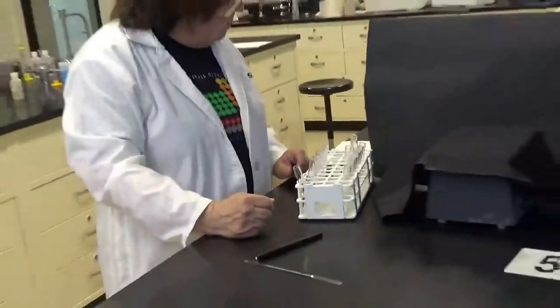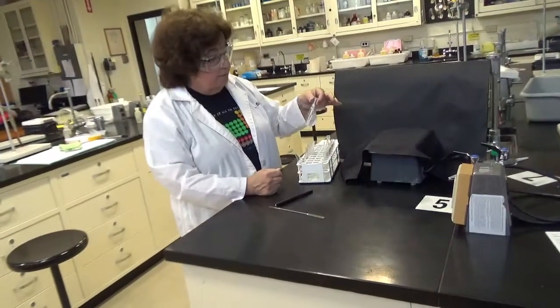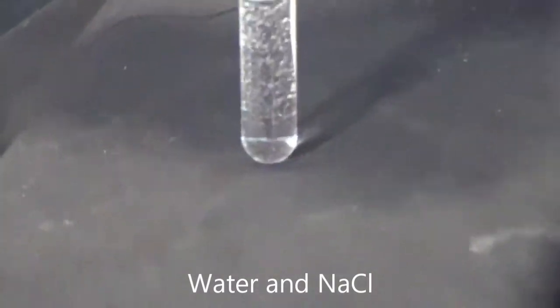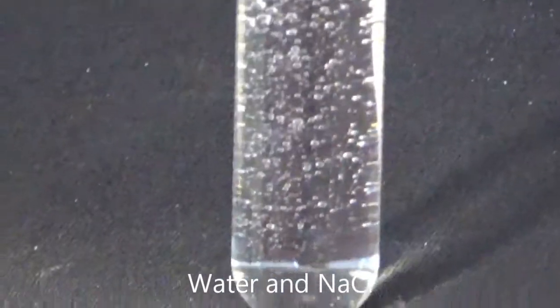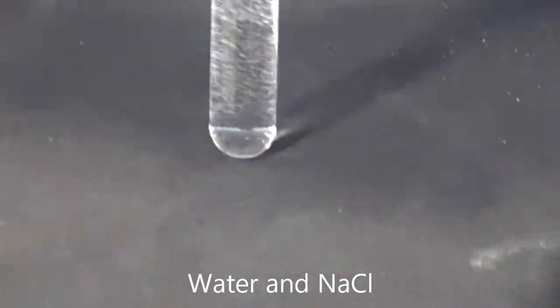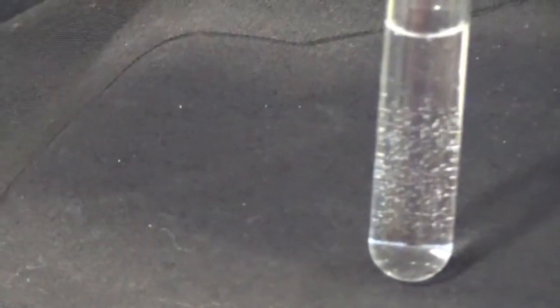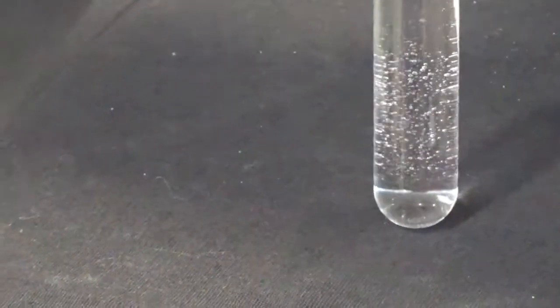Now, the second thing we're going to try is water mixed with a little bit of sodium chloride, salt. And there are some air bubbles in this test tube, but do you see any of the salt? Let's mix it a little bit more. If there was sodium chloride here, where would it be? Would it be suspended, or would it be sitting on the bottom? Do you see anything sitting on the bottom?